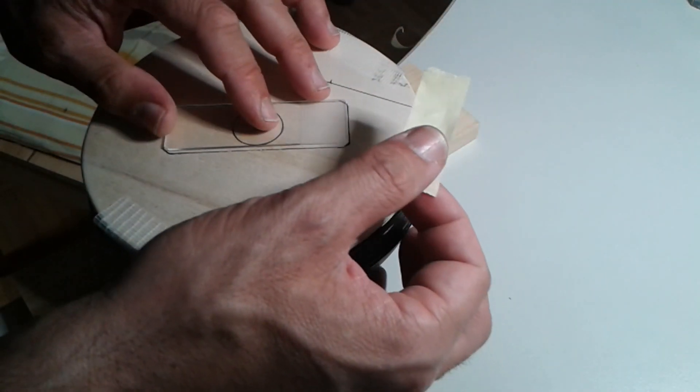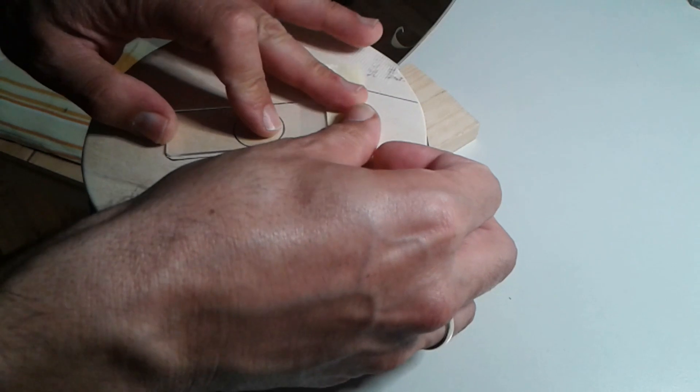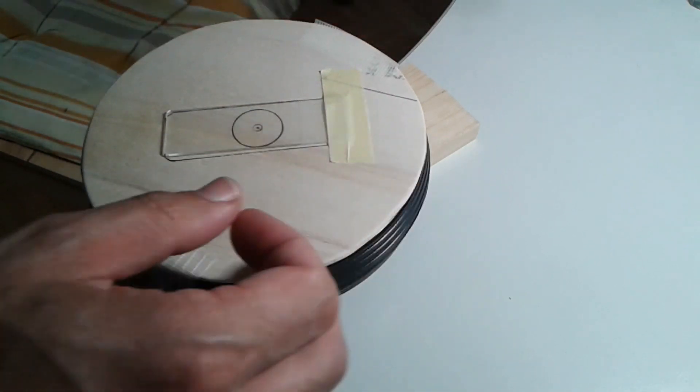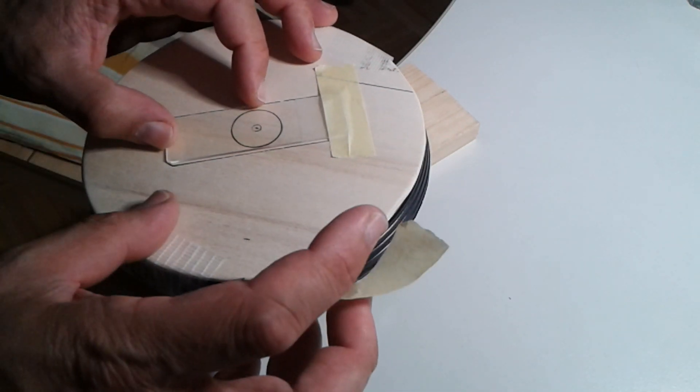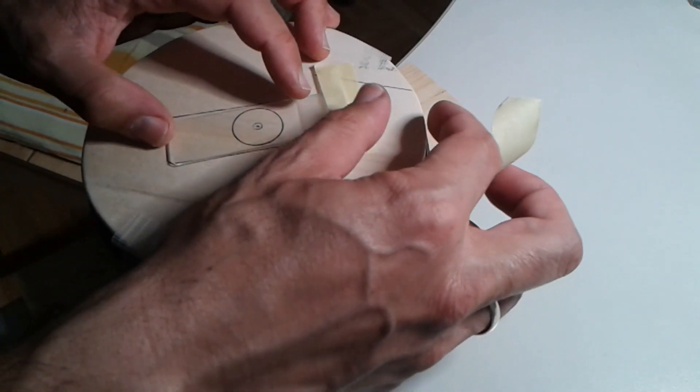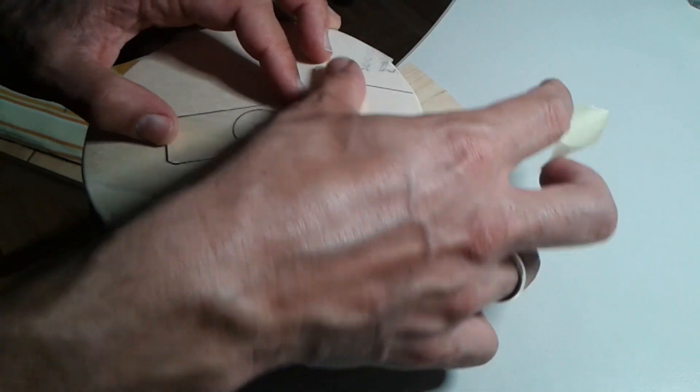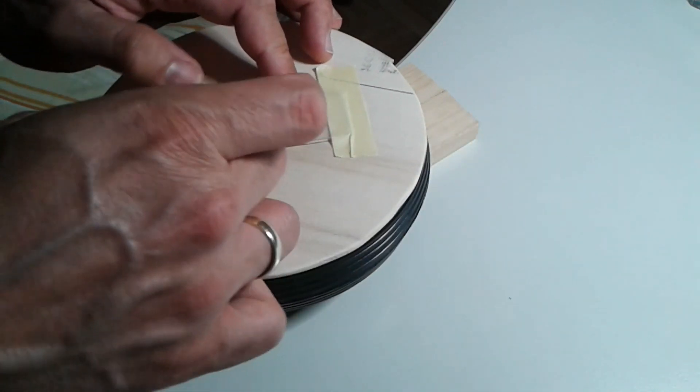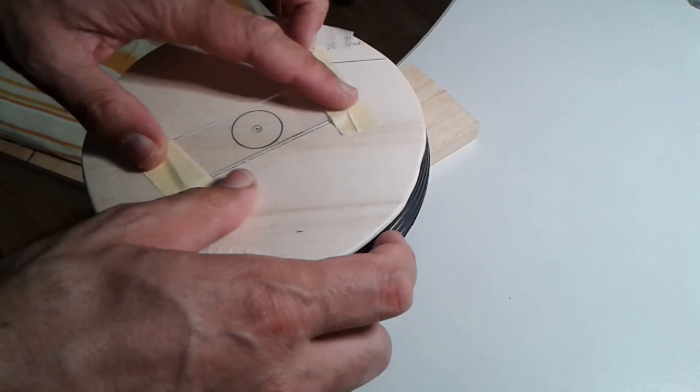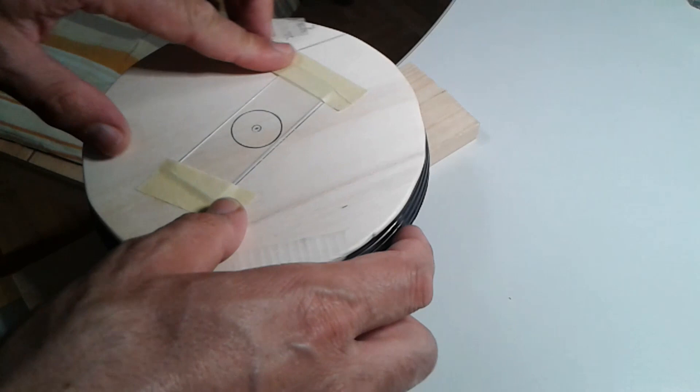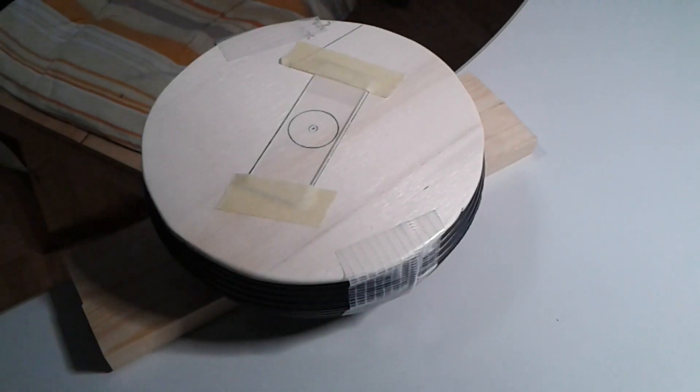I'm simply going to use tape to fix it to the slide ringing table. Normally you have to use clamps, but this is a very amateurish way of doing it. I think it should work.